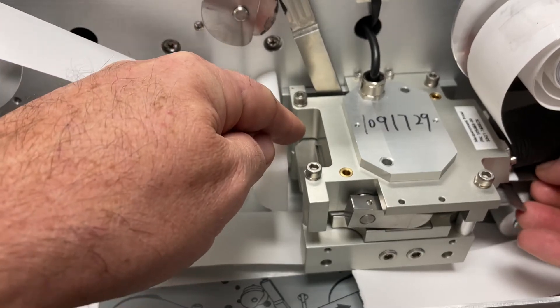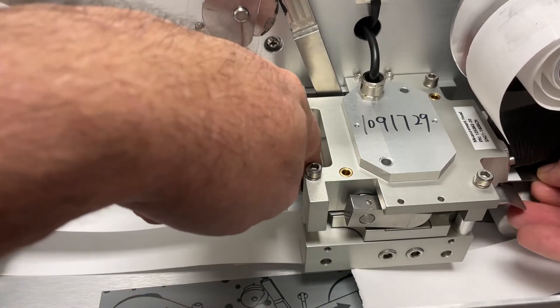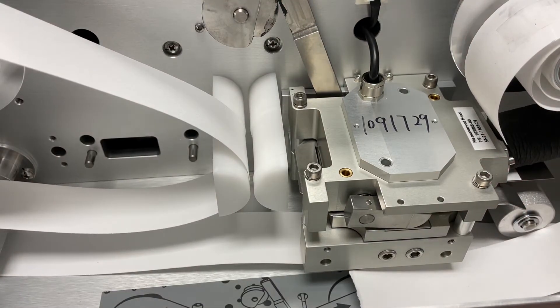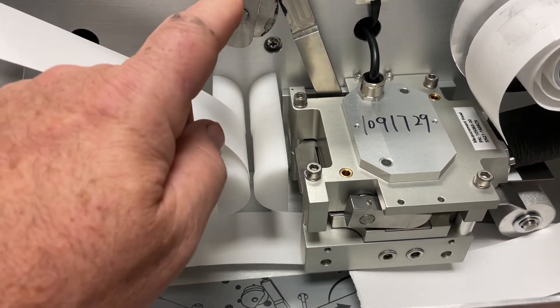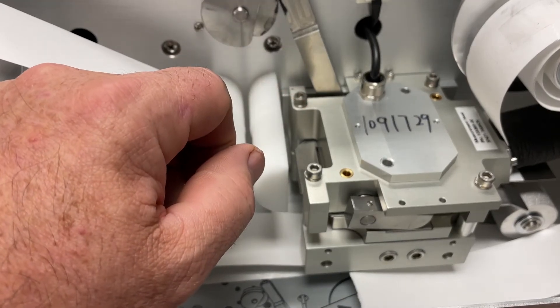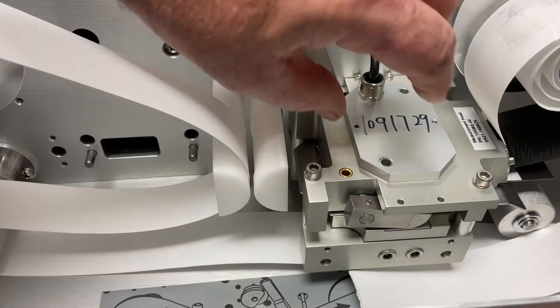You can see it peeking through right here—there's the front of it. That will actually stop. Just make sure the plate is all the way up and touching the front. After that is done, you can close this head from the front screen and then begin the calibration, the detector calibration.